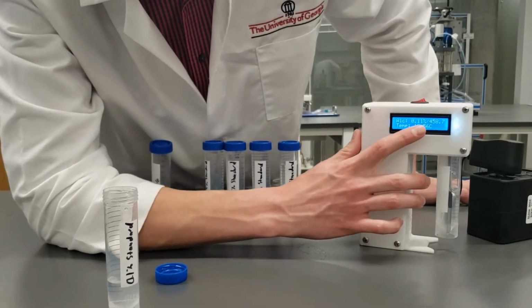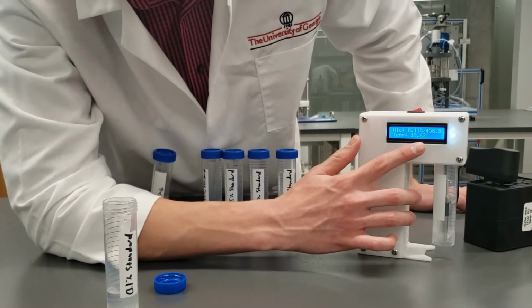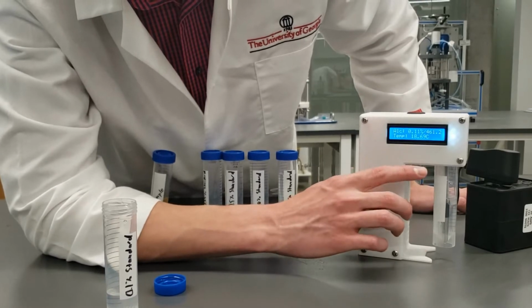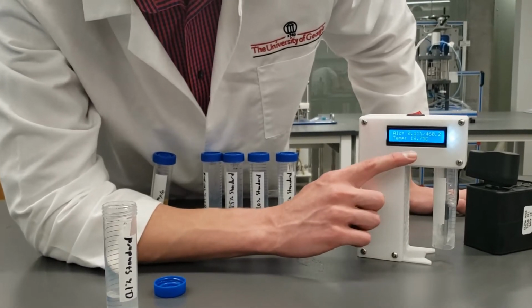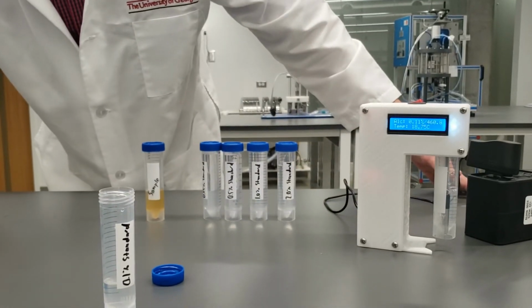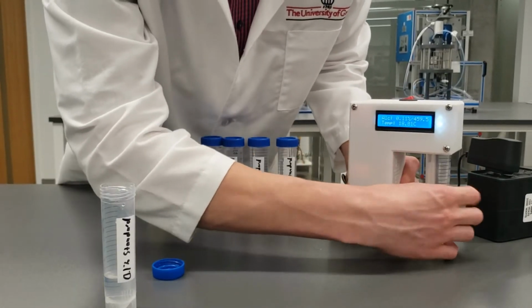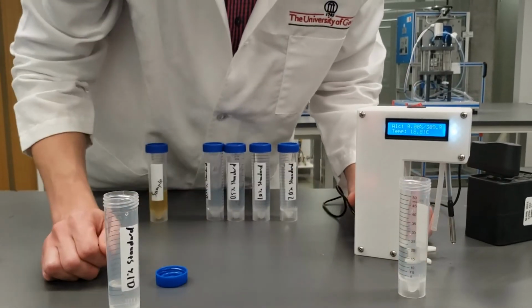So we're getting about 458 this time, which is one less than we were getting last time. Maybe we are getting about 459. You don't have to be perfect with these, just make your best guess. We'll say 460. That's what we're looking at, 460. So we've put 460 into our Excel document, and we're gonna move on with the rest of the samples.